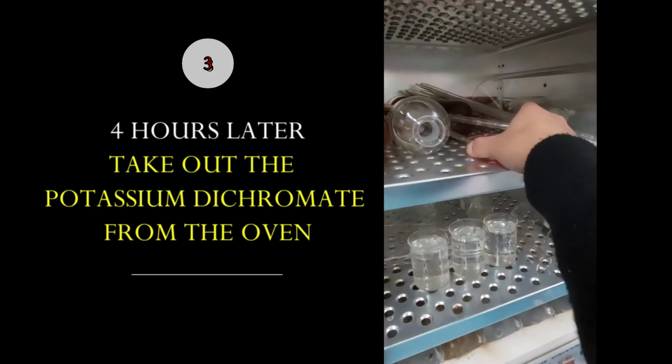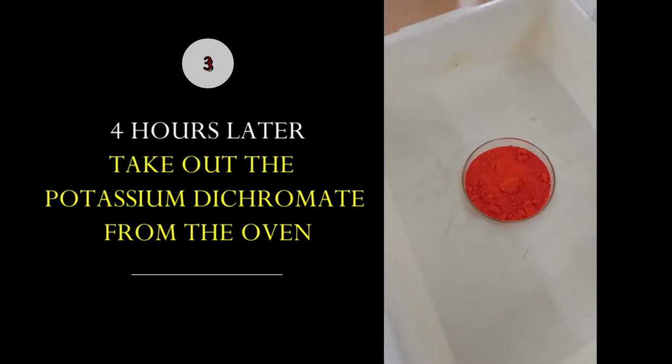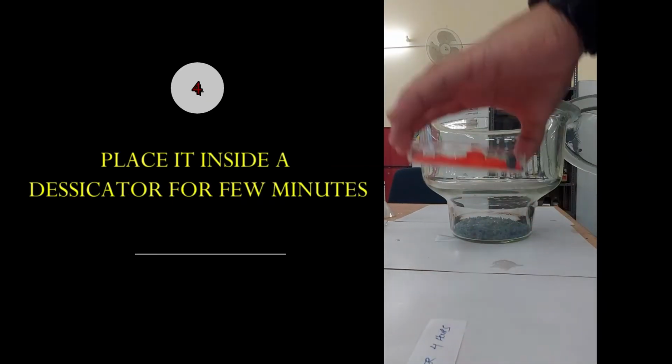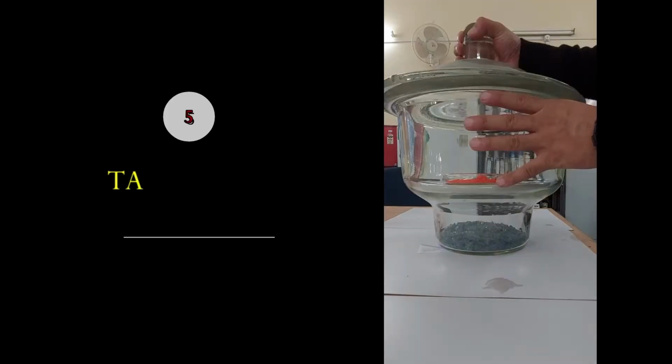After 4 hours, take out the potassium dichromate from the oven. You see that it's changed in color. And place it inside a desiccator for a few minutes. After some time, take it out.